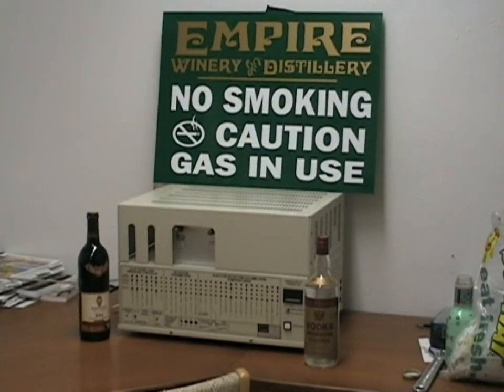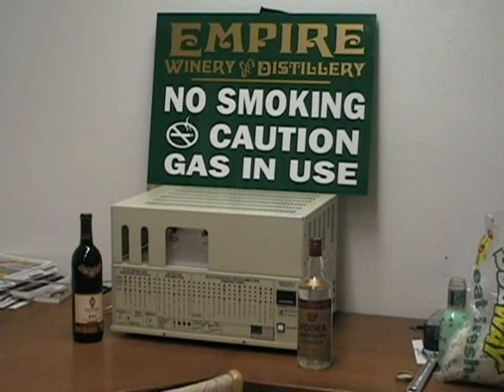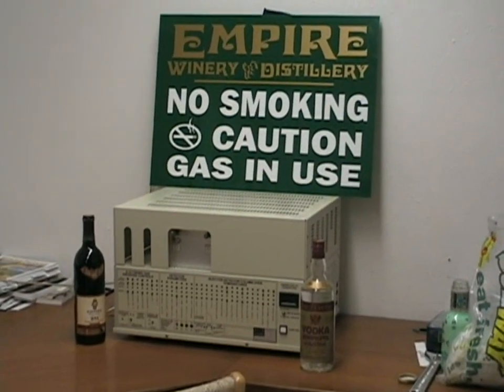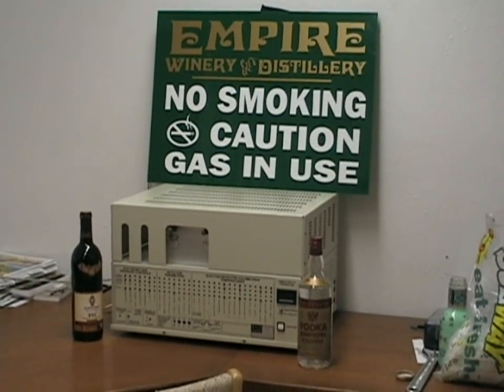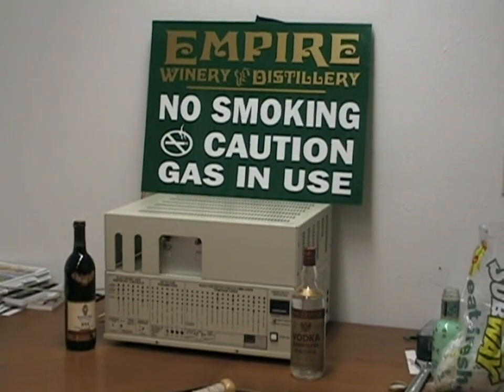This is the installation and operator training video for the Buck Scientific Model 910 gas chromatograph with heated injector and FID detector for Empire Winery and Distillery in Newport Ritchie, Florida.